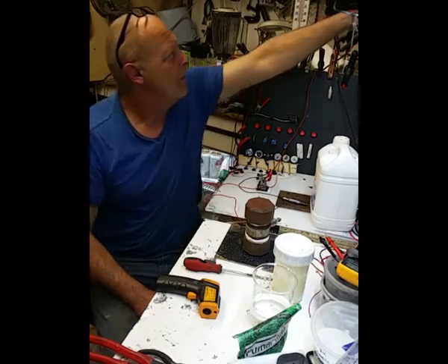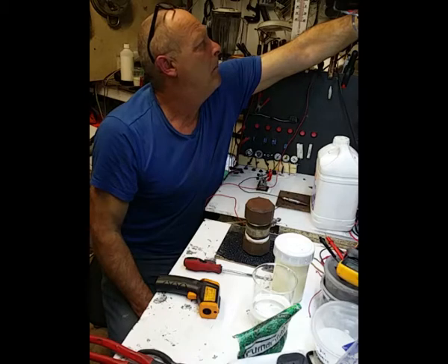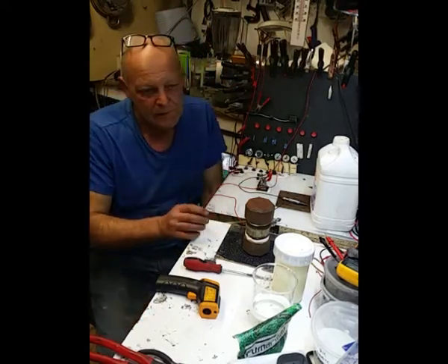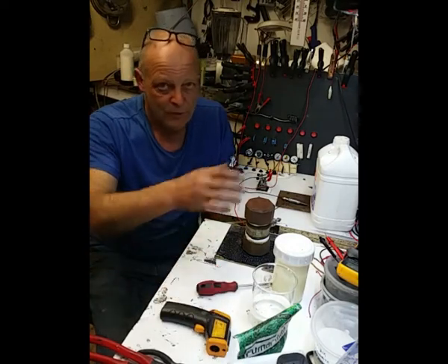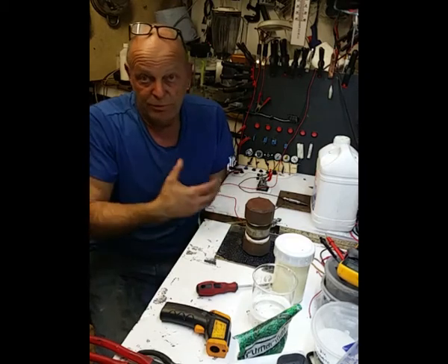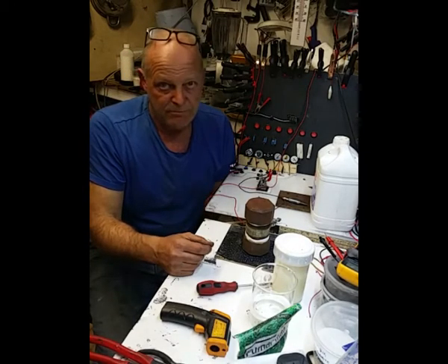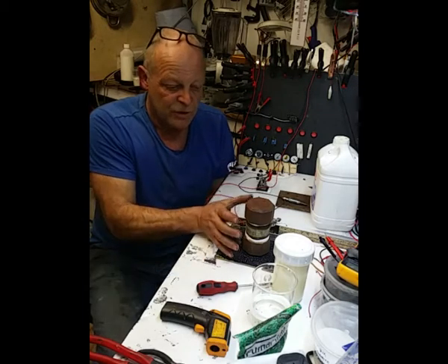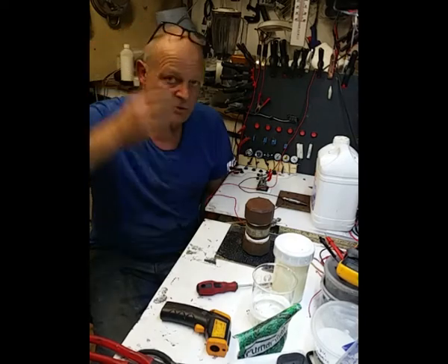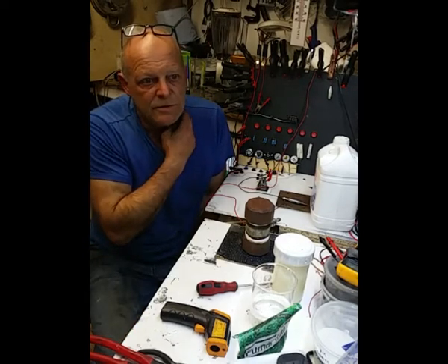6.7 amps. I'll turn it up a bit. Okay, 9 volts, almost 8 amps. Now, I've got to say this, although this is an experiment which I want to do on the bench, I would not just leave that sat there like that, with no protection for yourselves. I mean, if anything happened with that, or steam hurts. So, as I say, I would not just leave that without some protective environment around it, some sort of a cover, some sort of a thermal heat shield, whatever. So I guess that's got to be said.